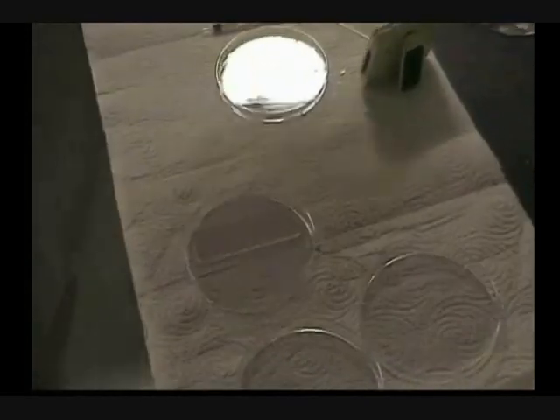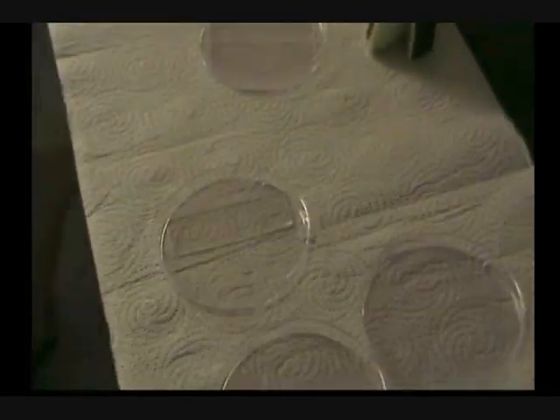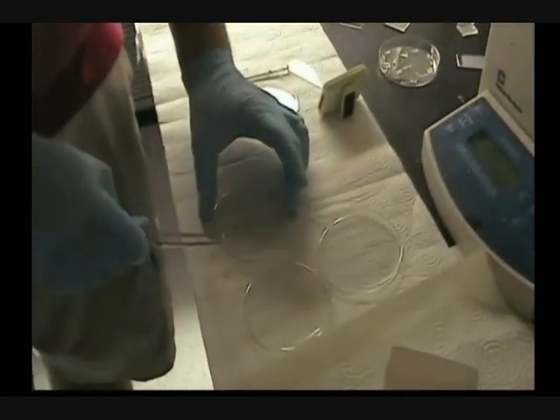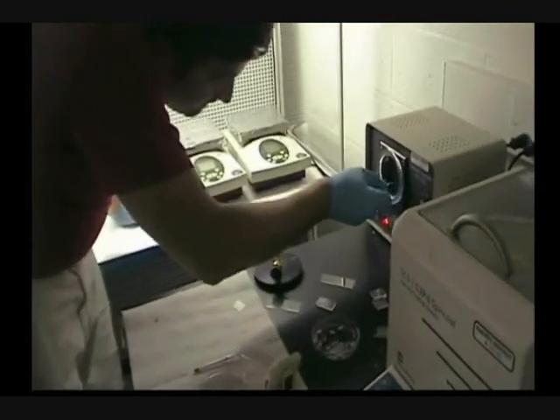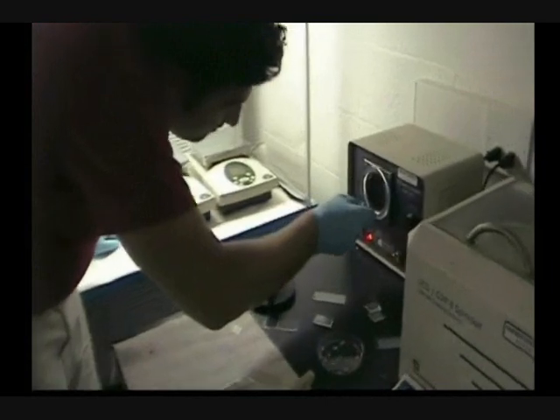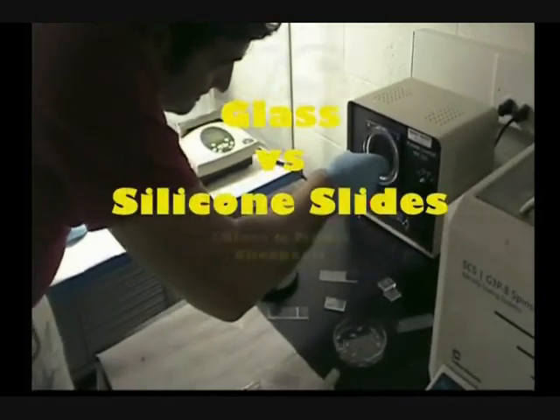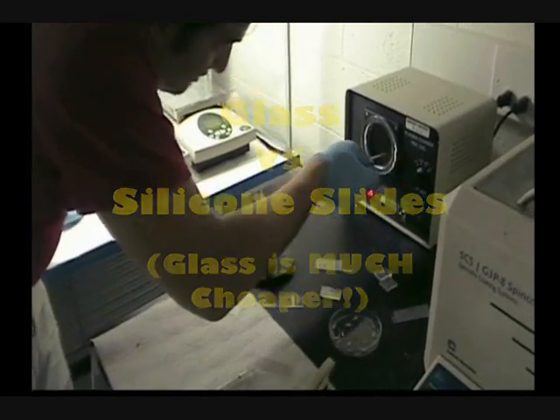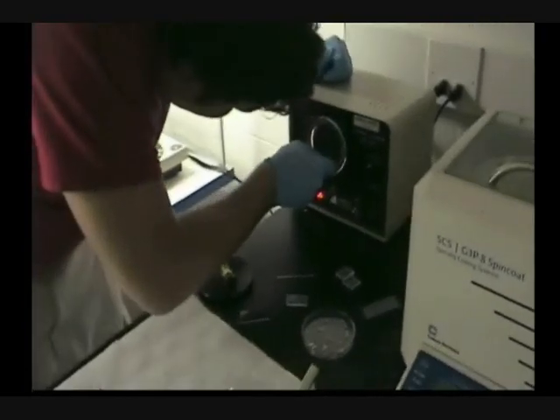In the next step we are going to spread the SU-8 on these glass slides. Now their surface is very clean and they are ready for the SU-8. Instead of glass slides, I may fabricate my mold on top of a silicon wafer, but in that case silicon wafer is a little bit more expensive than the glass slide. So glass slides work for us anyways.